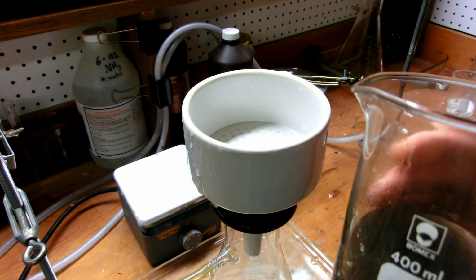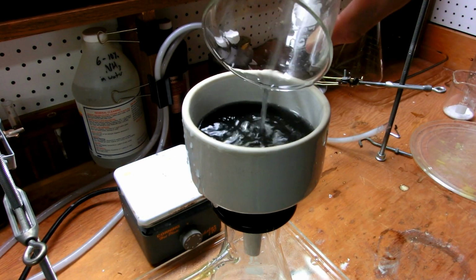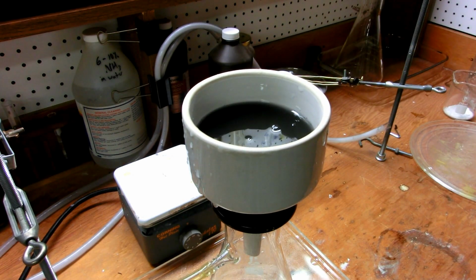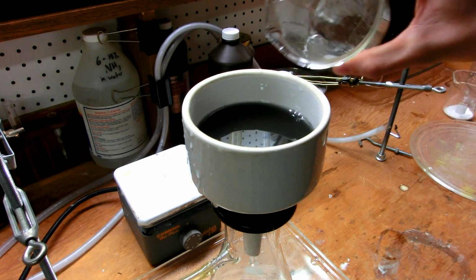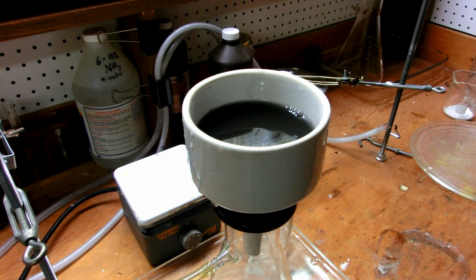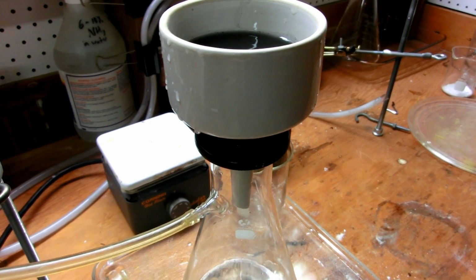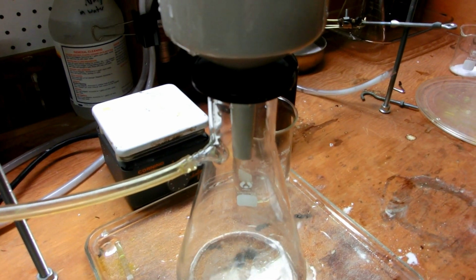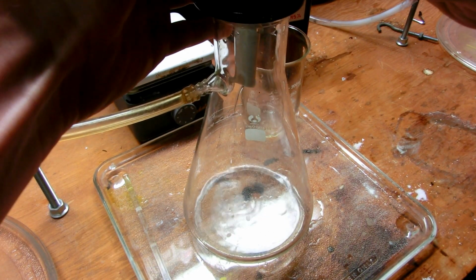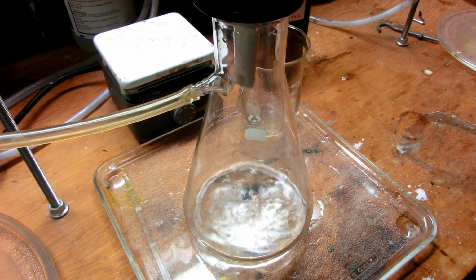And we are just going to filter this to get our ferrous chloride. This goes in here. I'm going to get a little bit of water to wash out this beaker. Stir it around a little bit. Okay. And you can see we have filtrate coming out. Now we'll lower the tripod, which is noisy as hell. Okay, so we have filtrate coming through. Should be bright green ferrous chloride. I'm going to start the vacuum by seating this Buchner funnel. There we go.